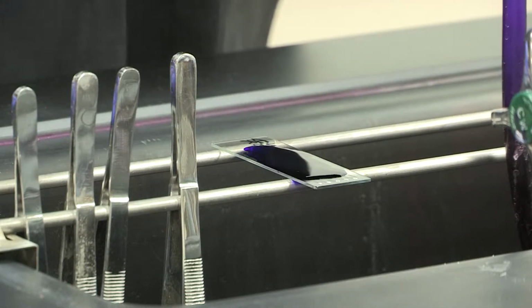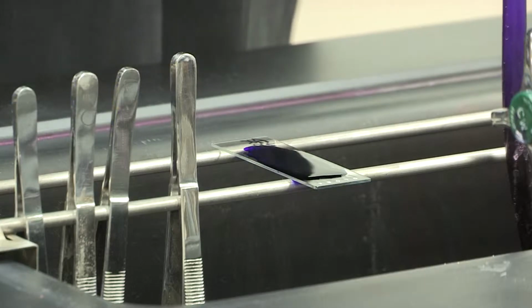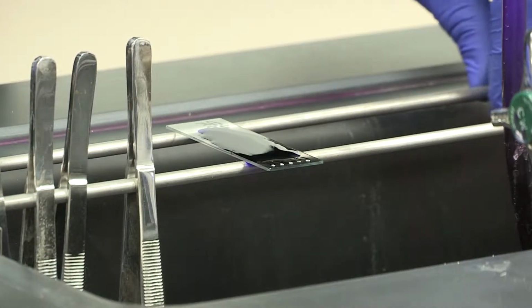Okay? Now, please also keep in mind that you have to have gloved hands in here, and that the purple dye may get on your gloves. Now, this is also where we can see whether or not sterile technique is being used, because lots of people put on their gloves and they touch their face. This dye will not come off your face very easily, and so we will know automatically whether or not you have good sterile technique. So after about a minute, you're going to want to rinse off that dye.